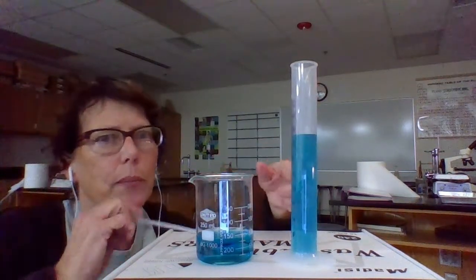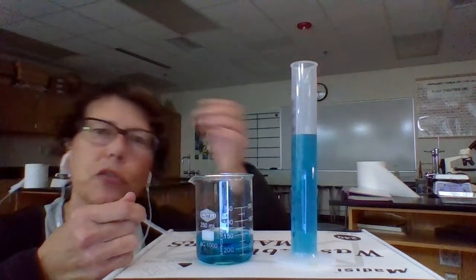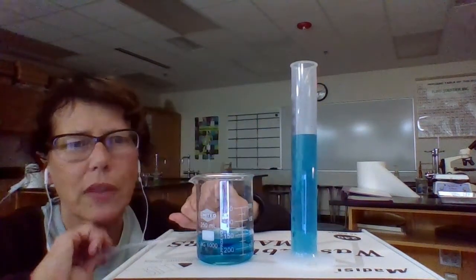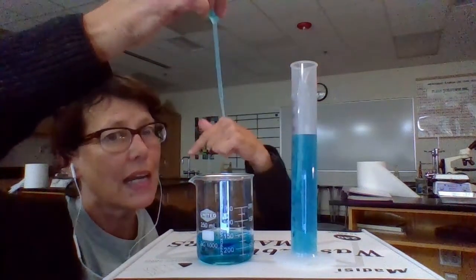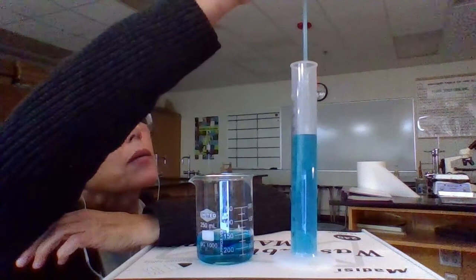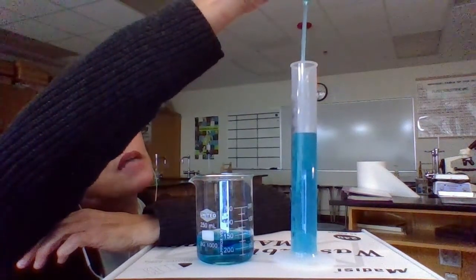Because then you get into the back and forth where you're dumping water out and then adding water back, and it's too much. So you dump some out, and now you've taken away too much. So we don't mess with that. Use the pipette, and you can be super accurate. So I'm going to draw up some water into my pipette. I'm going to stay down here so I can watch when I get to the right amount of water in there. And I'm going to add it a few drops at a time until my water rises to 80.